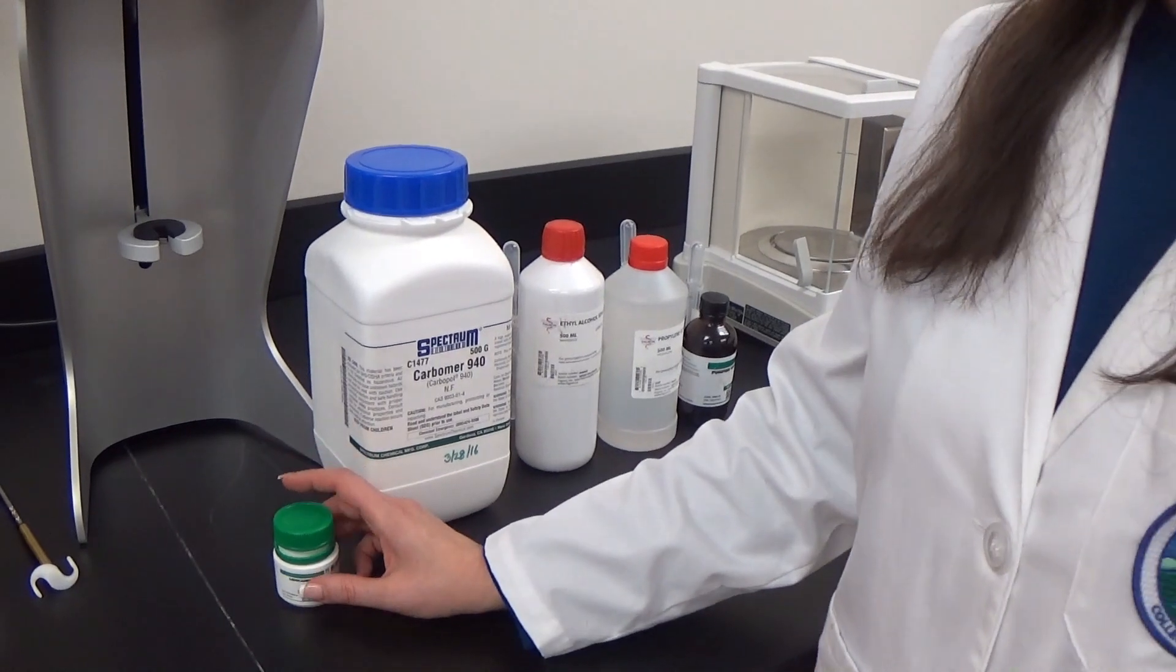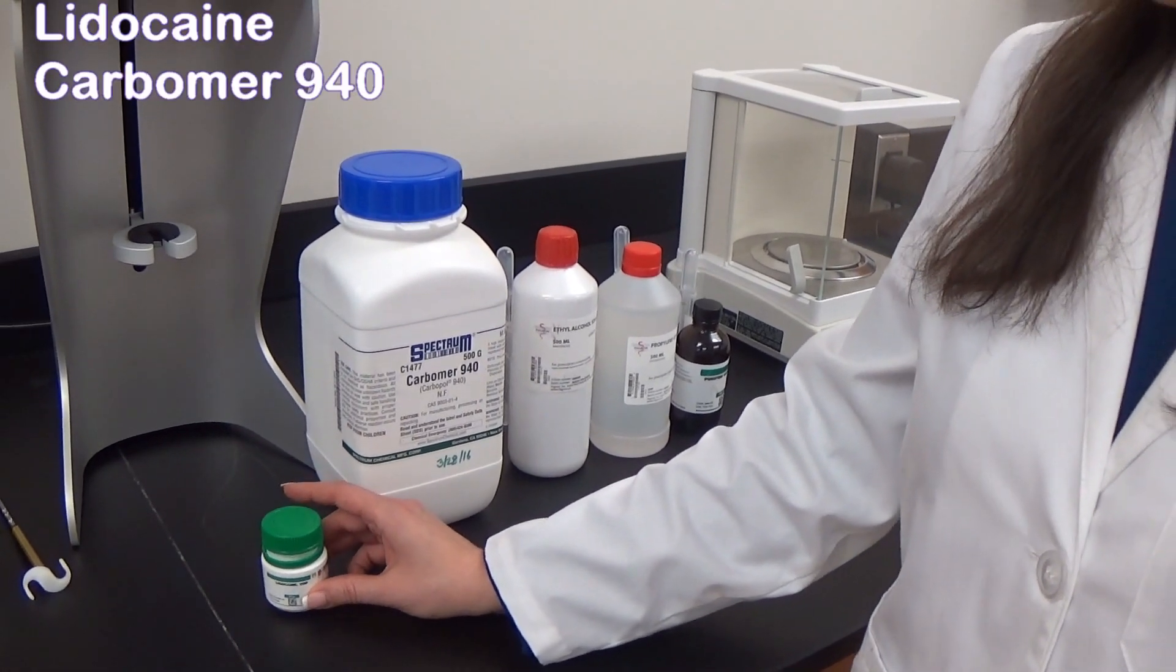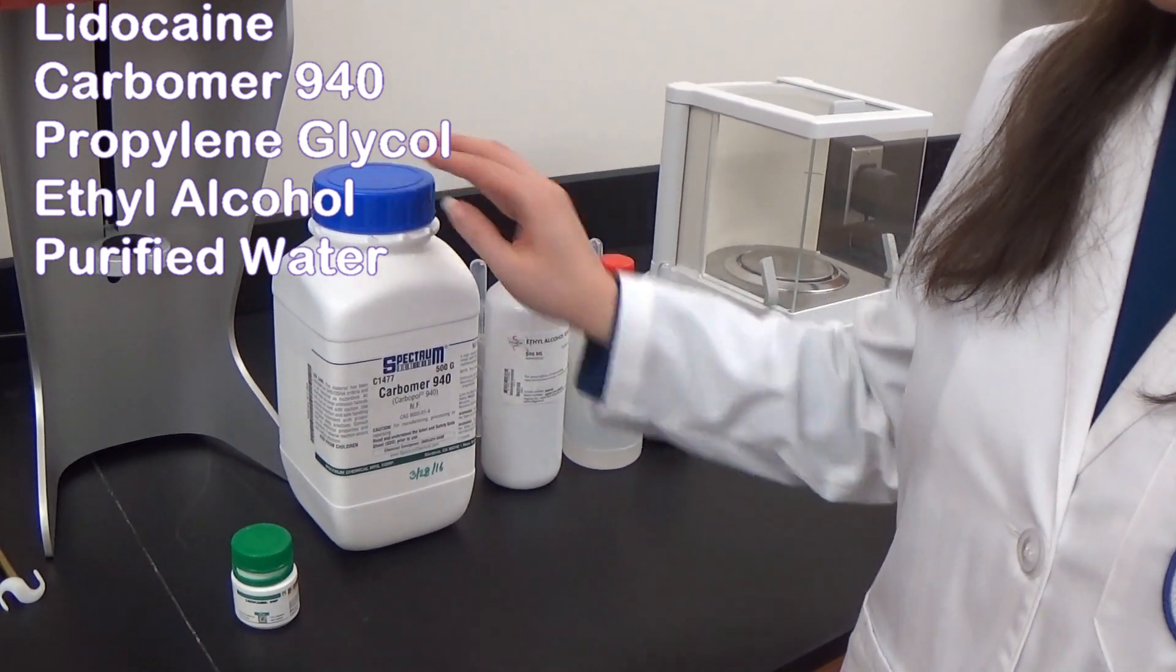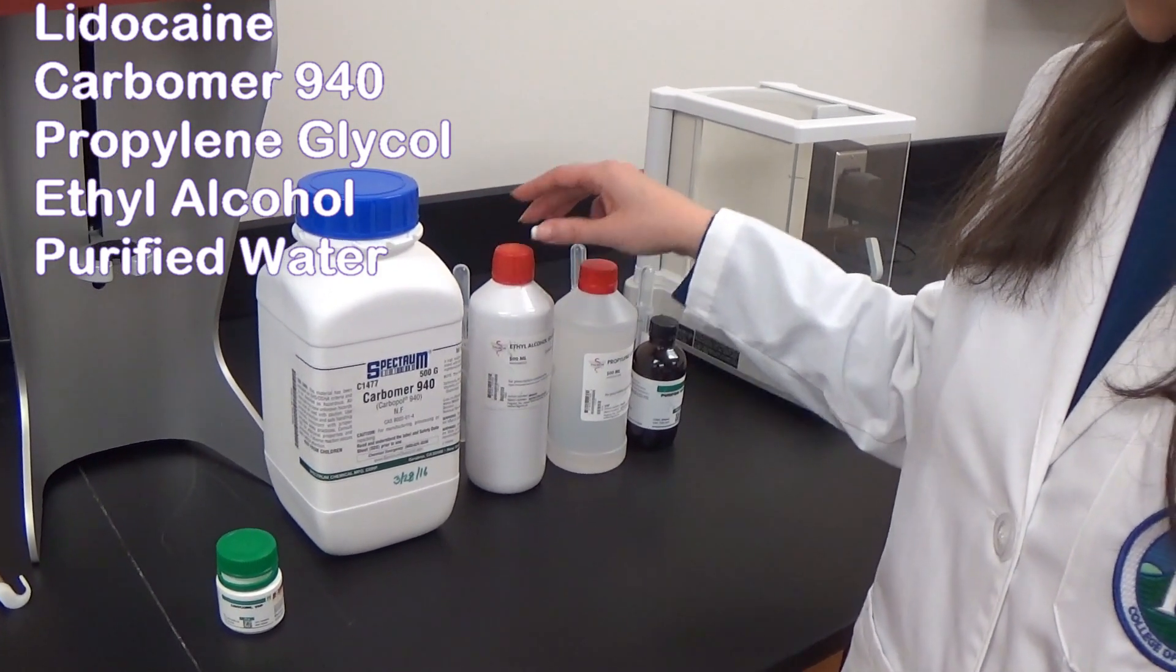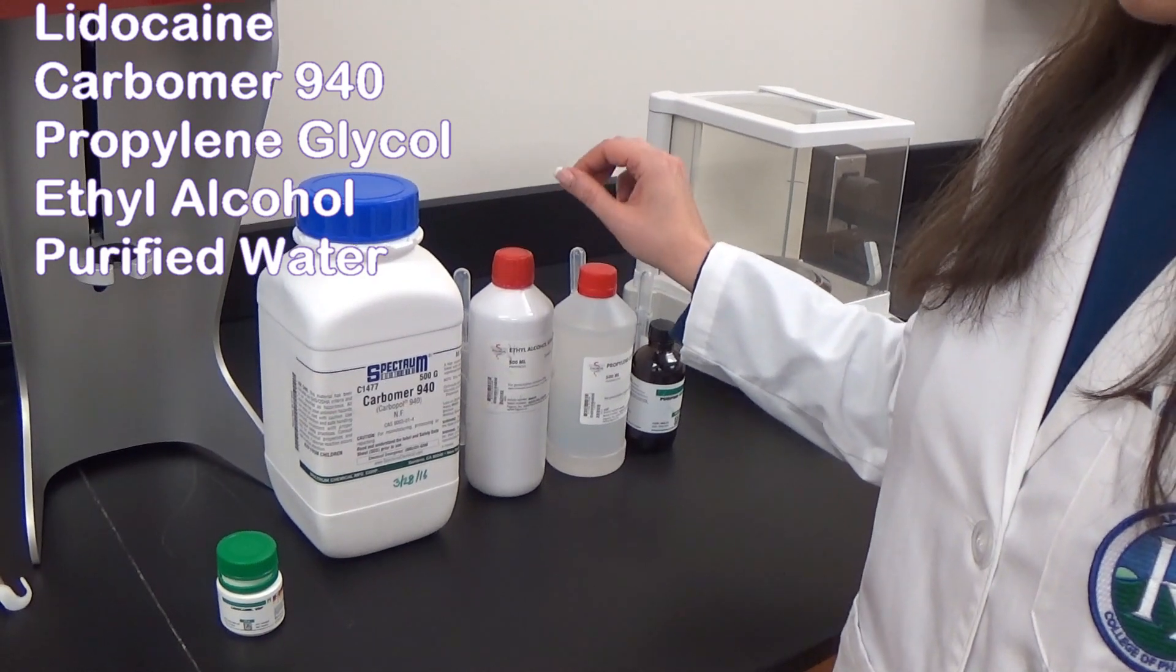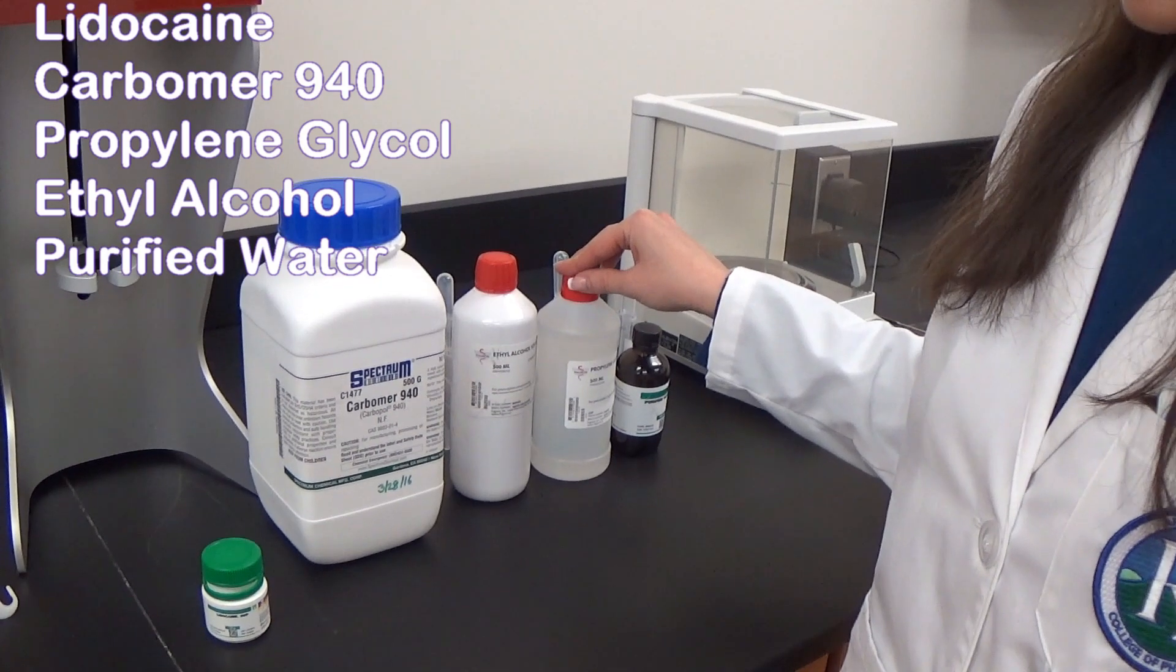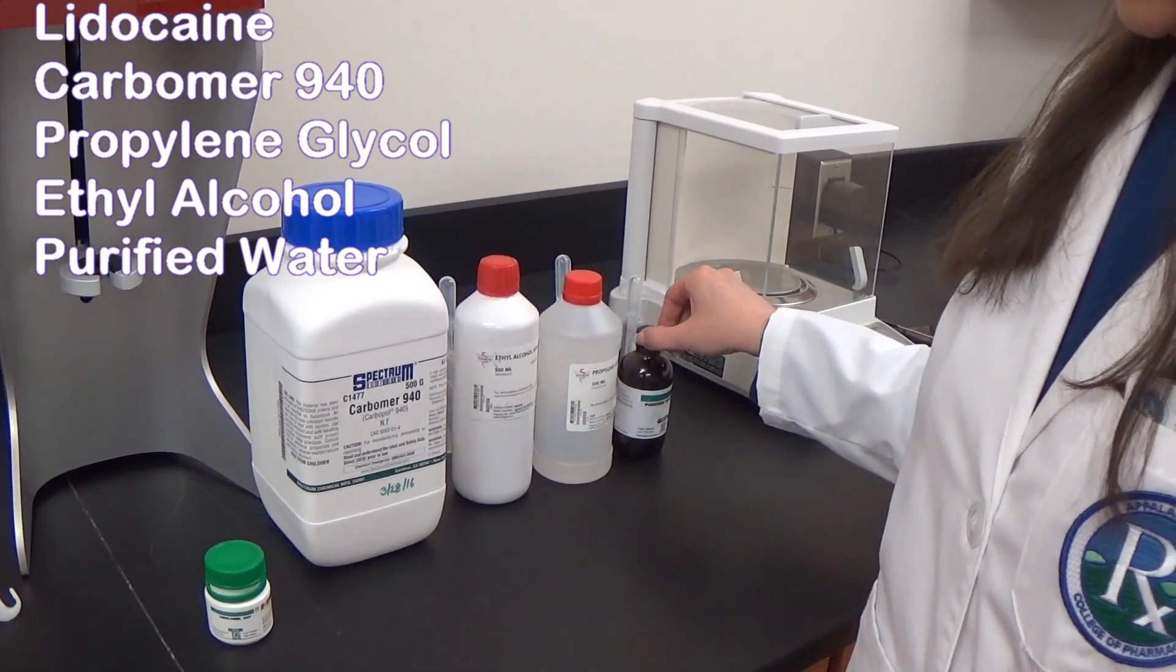To make the product, we will use lidocaine, which is a local anesthetic drug, carbomer, a gelling agent, and propylene glycol and ethyl alcohol, which are used as a solvent, antimicrobial preservative, and penetration enhancer, and water as a solvent.